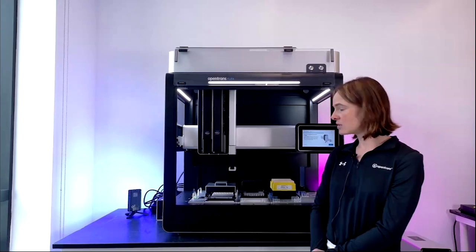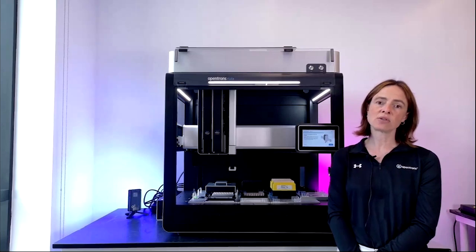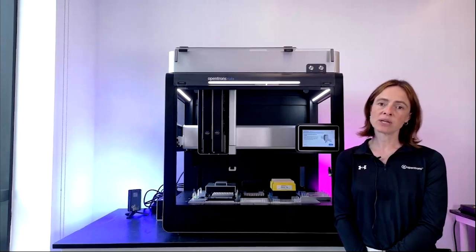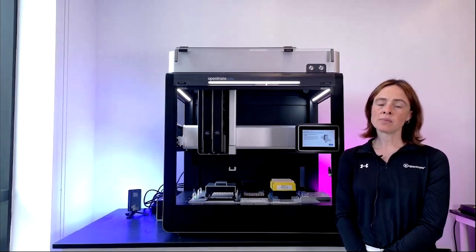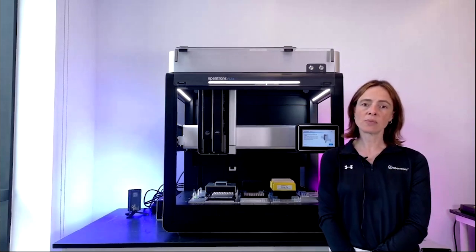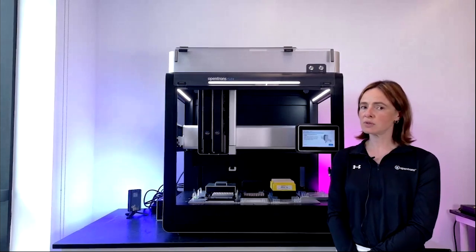Jumping in to talk about the Flex itself, I'm going to show you a few key features on the Flex, and then Nick is going to run through a short demo about finding and configuring a pre-existing protocol from the library, and then running it, and then we'll take questions, as I mentioned. But you can type in your questions at any point, so from now on. Our software engineer, Nick Deal, is monitoring the Q&A box while we talk, so feel free to ask questions at any point.